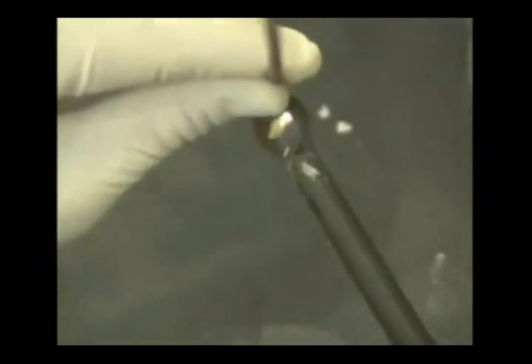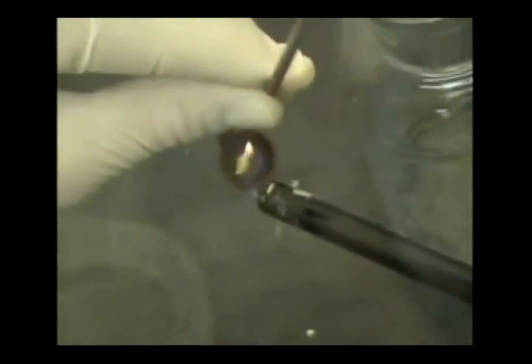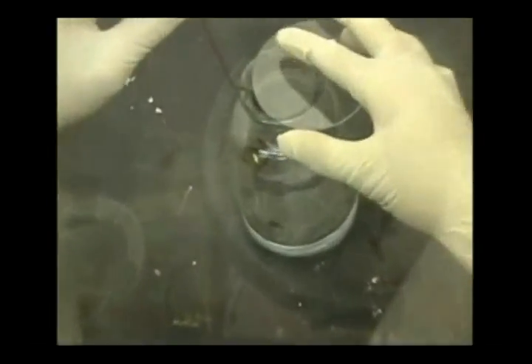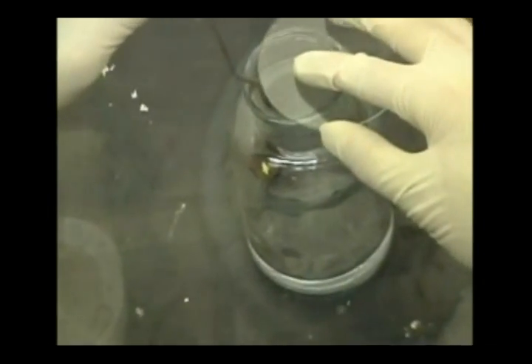We are now igniting a pea-sized piece of sulfur. We are covering the glass bottle with the cover glass in order to keep the smoke from escaping.